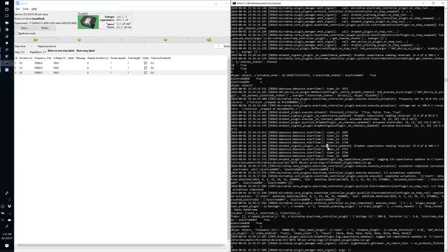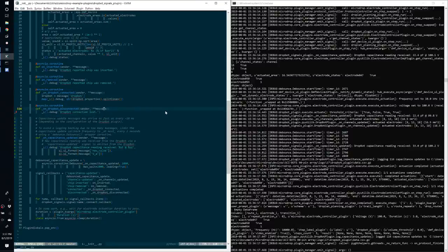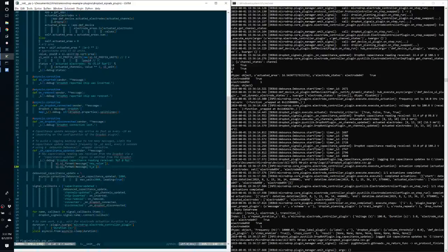at the actuation voltage. And so this video demonstrated how we can take the DropBot signals plugin and enable it in MicroDrop to log out these different messages. But you could be doing anything under these, and that could include writing some capacitance values to a file, or using capacitance values to then do custom actuation of the DropBot.